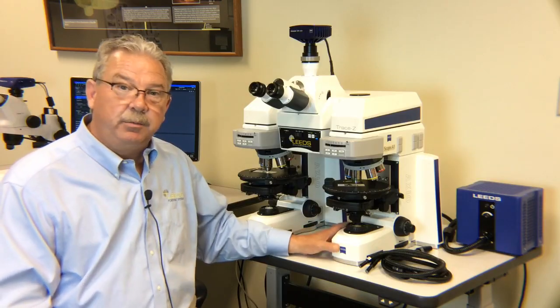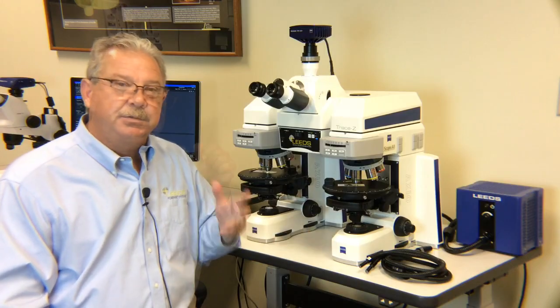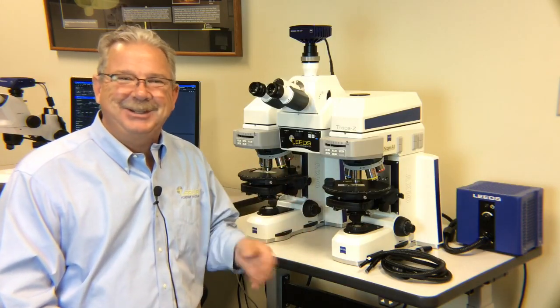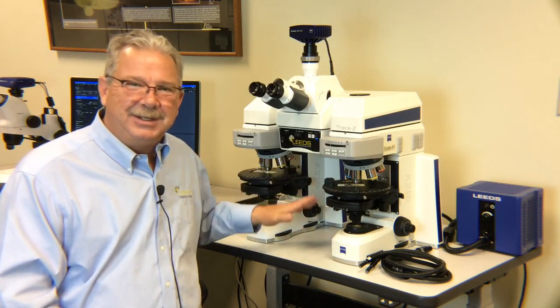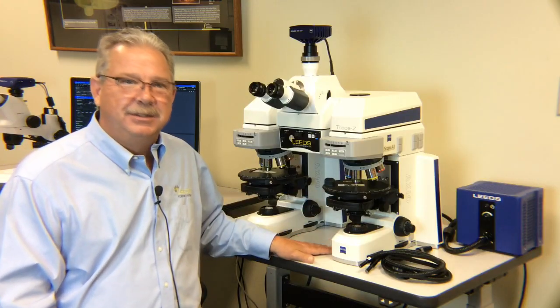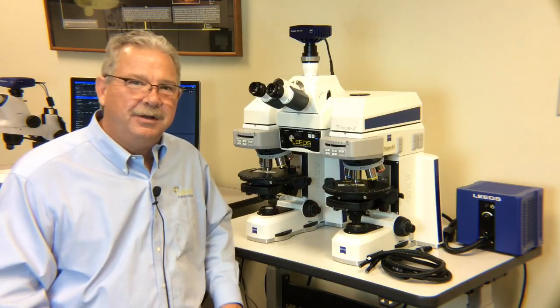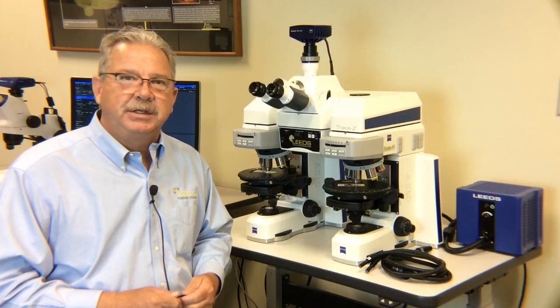So the point is you're going to be familiar with the microscope sales portion of it, and the sales pitch, I don't like the word pitch, but the sales pitch on this instrument is so simple. We bring together and we offer you intensity balanced and chromatically balanced images. Now that might not sound like a big deal to you, but first of all, we need to understand how critical color is to a trace evidence examiner.